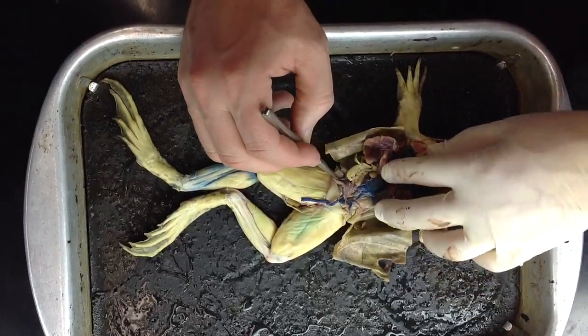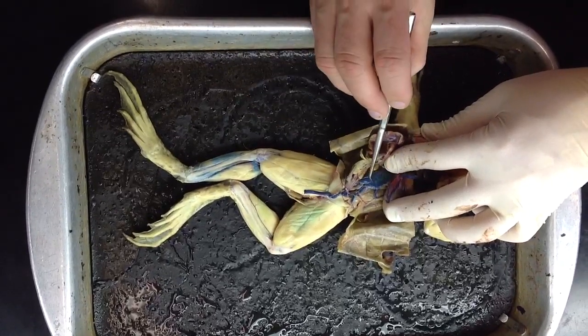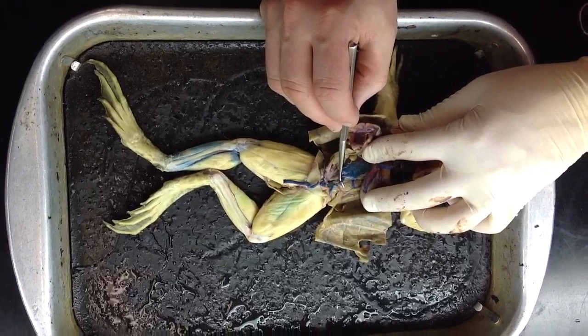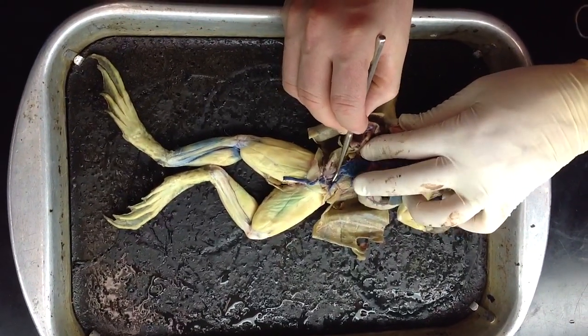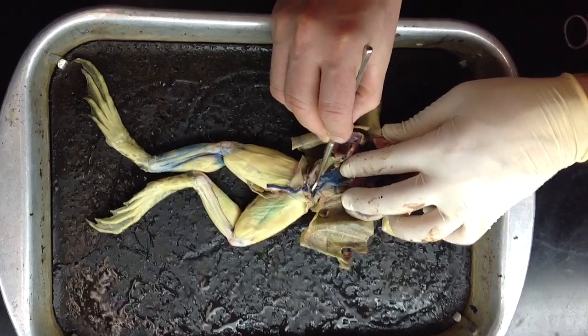Blood coming into the kidney comes in by way of this renal portal vein here. This is the kidney. So it comes in by way of the renal portal vein, which is formed by two veins draining the hind limbs. That's the sciatic vein right down here. I'm not sure if you can quite see from your angle, but that's it there.